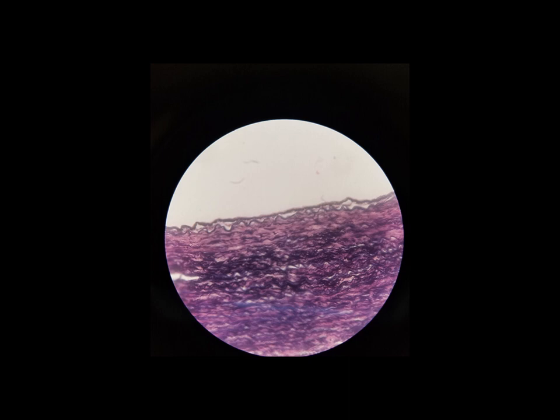So that's the last of the tissues that we will be looking at in this lab. And we're going to look at some more tissues in future labs, but for right now, spend your time looking at these tissues. This is just meant to be a supplement. There is no excuse not to actually have these slides in front of you in lab with a microscope studying the actual tissues.